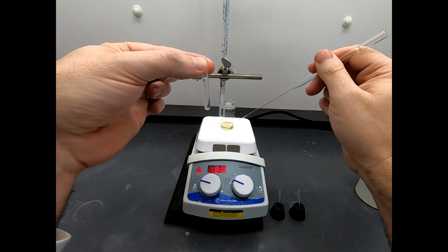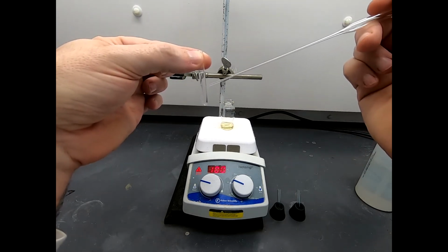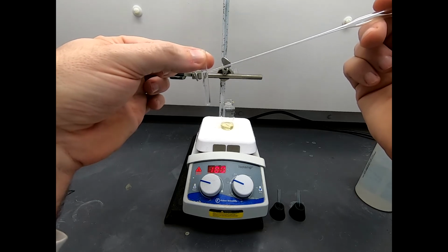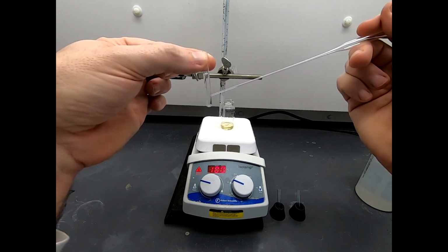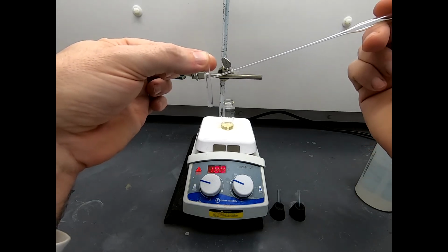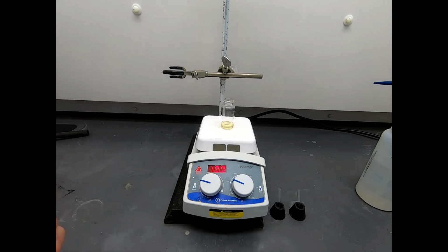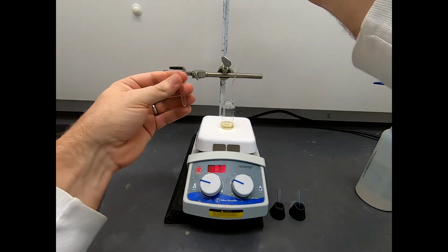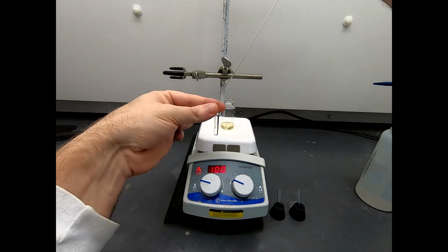I'm going to take a drop of our reaction mixture and put it in here and give it a chance to mix, and then our product should go into the ether layer, and all the acids and really polar materials ought to stay down here. And now when I do the TLC, I'll just sample from the ether layer. We're really doing a miniature aqueous extraction of this reaction. And we're just taking a little sample. I'll just get a drop.